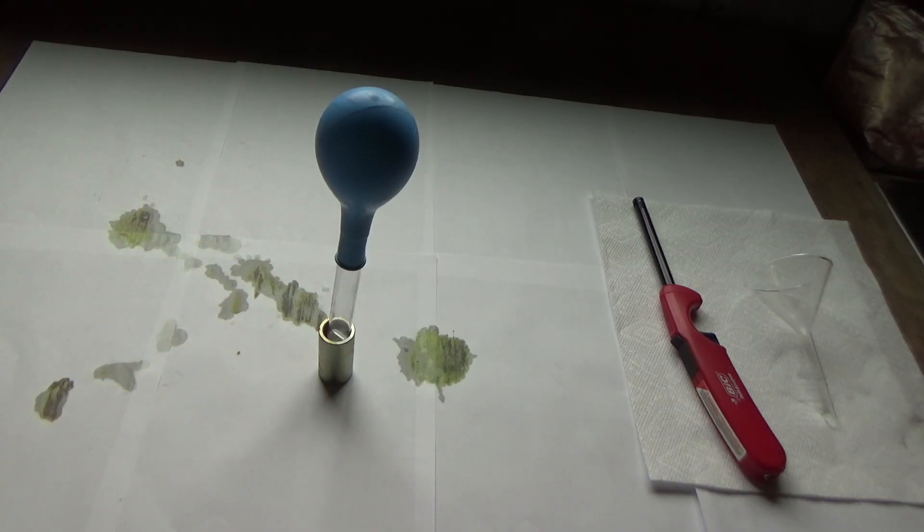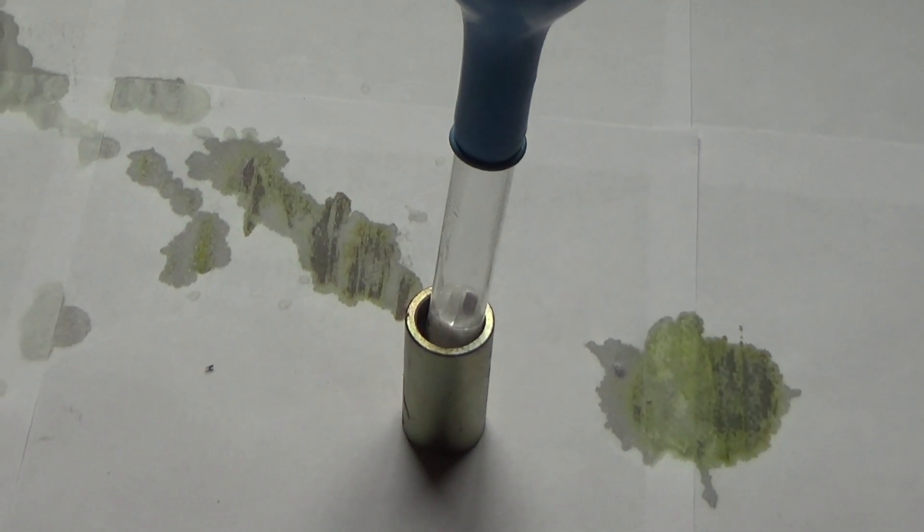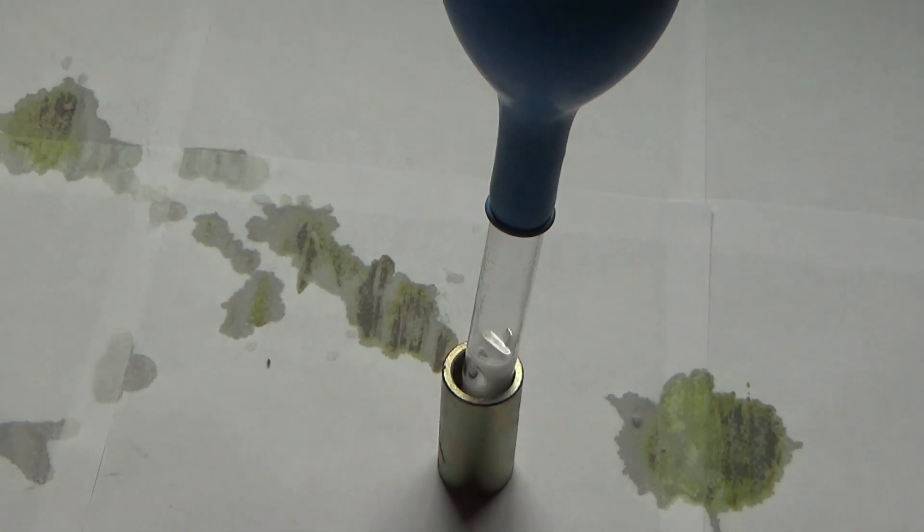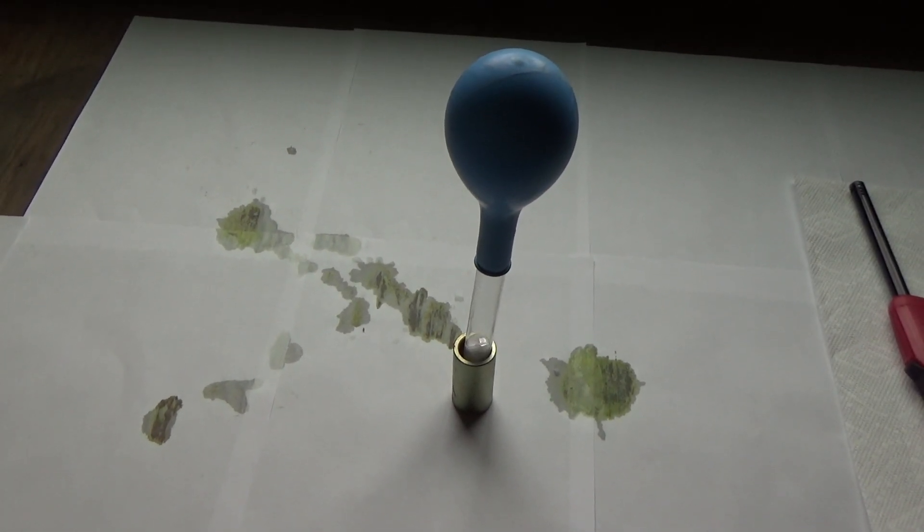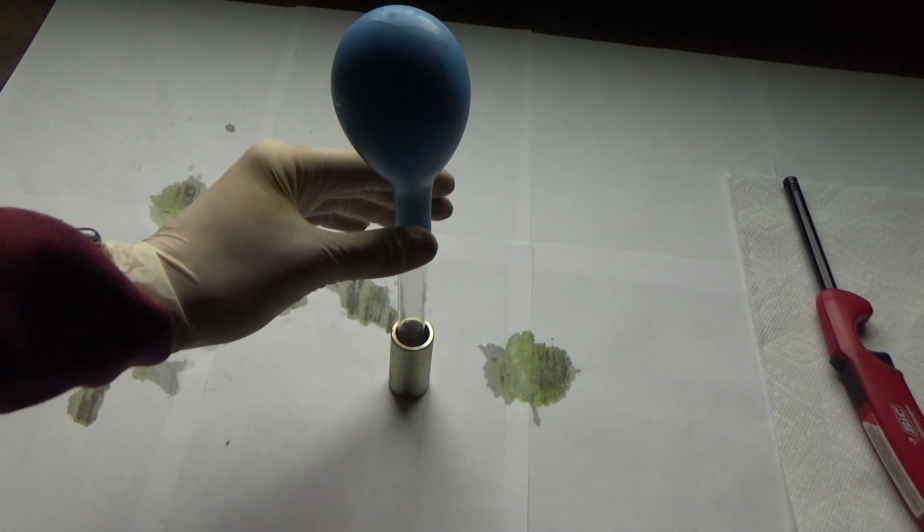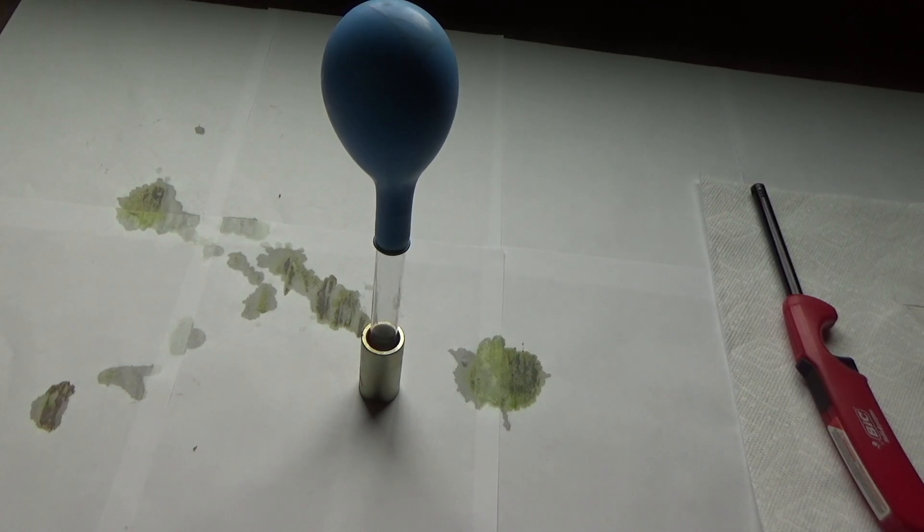And the balloon is filling up slowly. The balloon is filling up and the reaction is taking place. A little bit warm. It is an exothermic reaction. And of course, my camera battery is about to die.